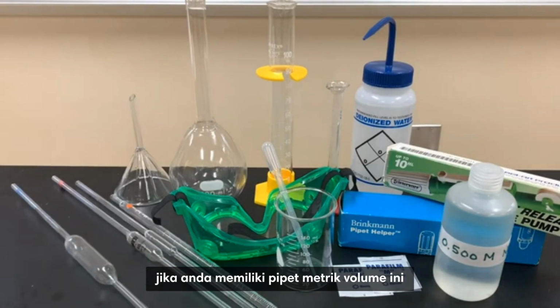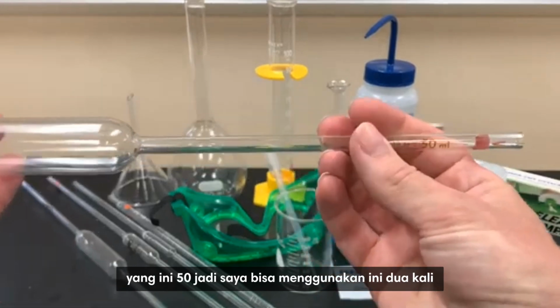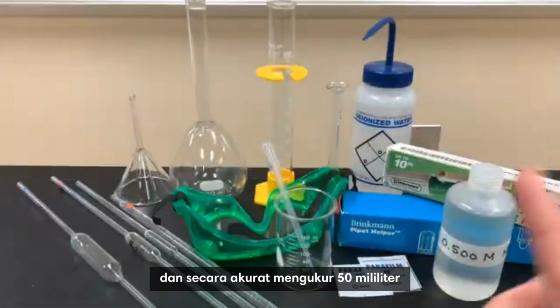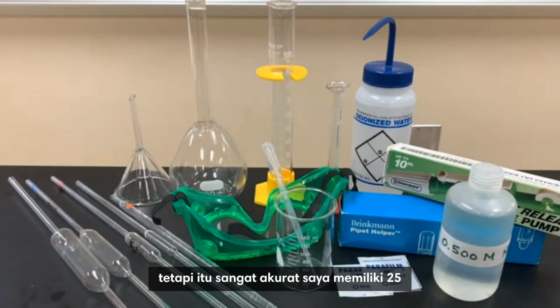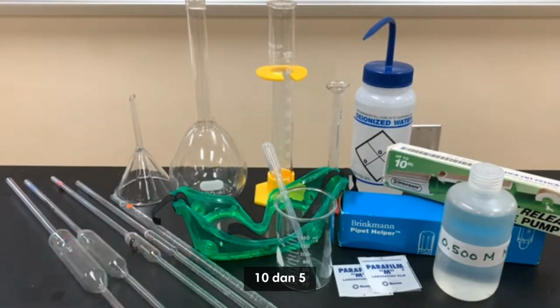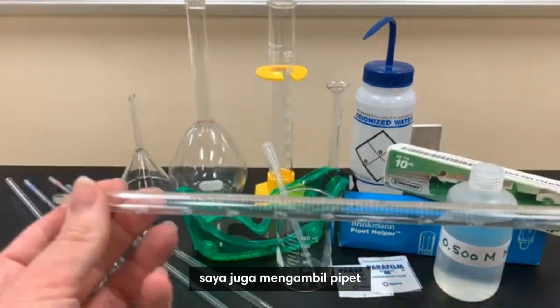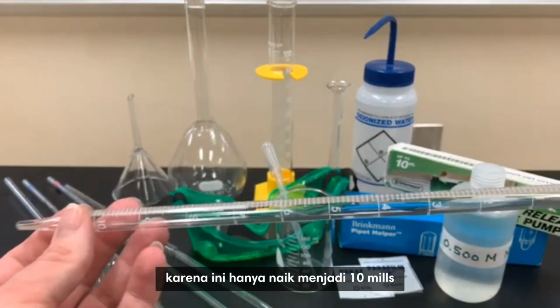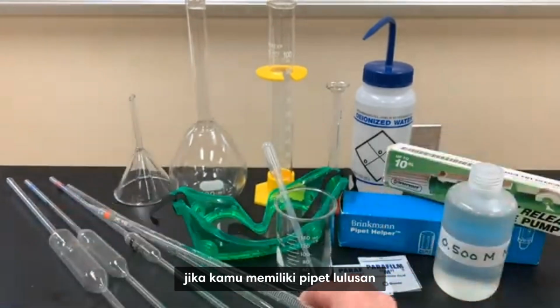Number one, if you have these volumetric pipettes, I would recommend using these. This one is a 50, so I could use this twice, and it accurately measures 50 milliliters and only 50 milliliters, only one volume, but it does so very accurately. I have a 25, 10, and 5 just to show you that there are smaller versions. I've also grabbed a pipette, so if you had smaller volumes, this won't work with ours because this only goes up to 10 mils, but this has markings every 0.1, so it's also very accurate if you have a graduated pipette.